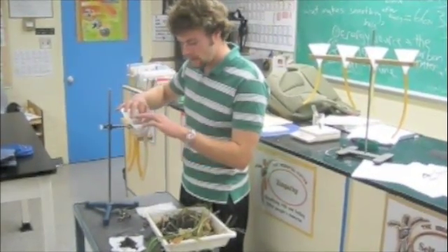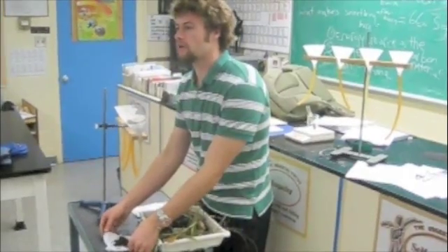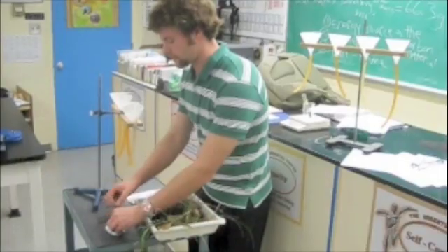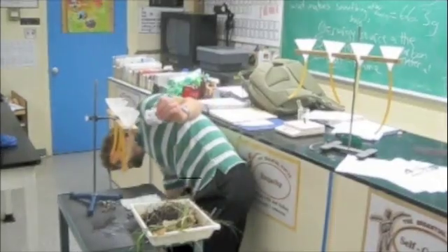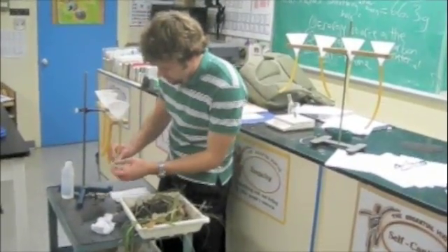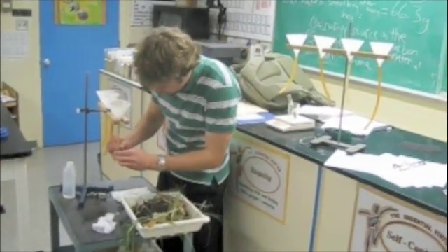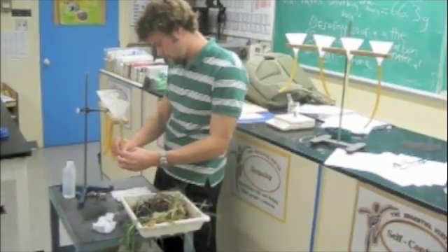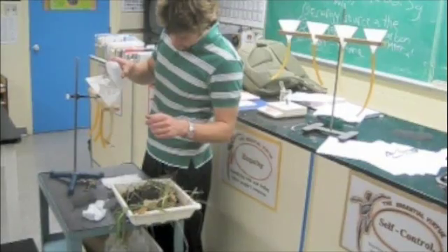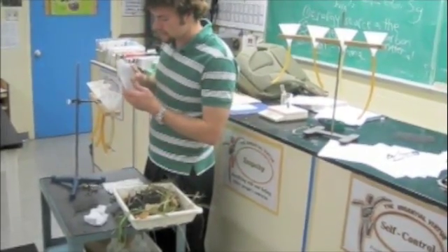I should have shaped that before. So I have that in. What I'm going to do is take a portion of this soil sample — I don't want all this grass and stuff, I want the soil part. If some of you have grass in yours, you can just pick it out. With my hand, I'm going to pick out some soil and put it in the cheesecloth. Grab it by the four corners and fold them in, then close this off because I'm going to put it in and fill it with water. I'll fill the water into this funnel.